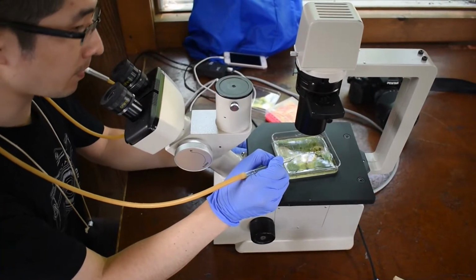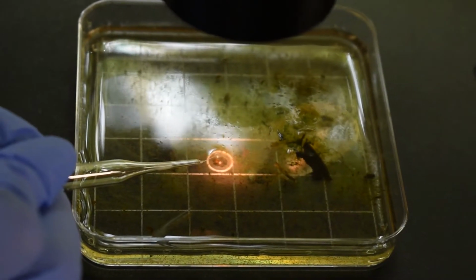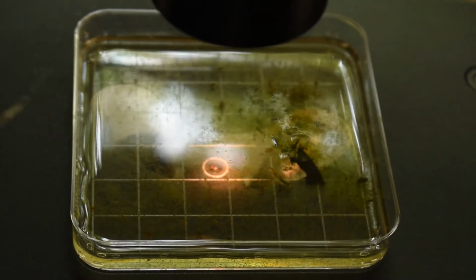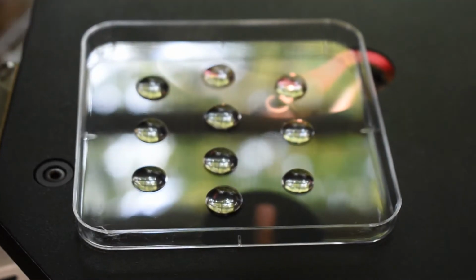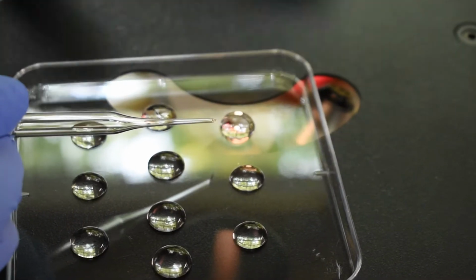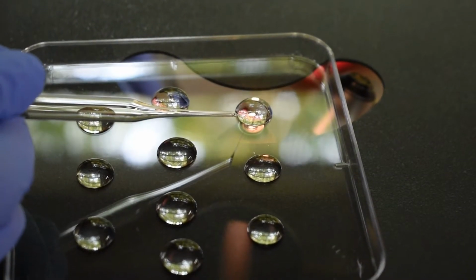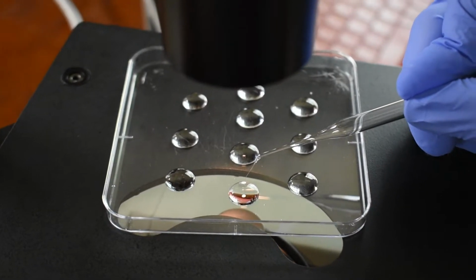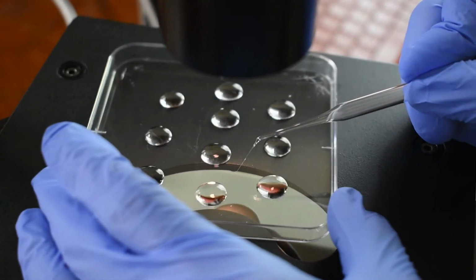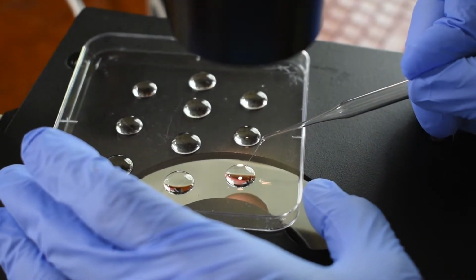Dr. Cito uses his mouth pipette to suck up the sample, in this case, a single infected diatom. Under the microscope, the sample is expelled into the first drop. It is helpful to always keep your eye on the sample by focusing on the tip of the pipette as the sample is expelled. Dr. Cito transfers the sample from one drop to another, removing as much debris as possible and diluting any contaminant bacteria.